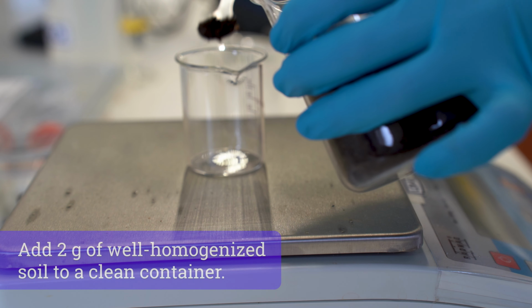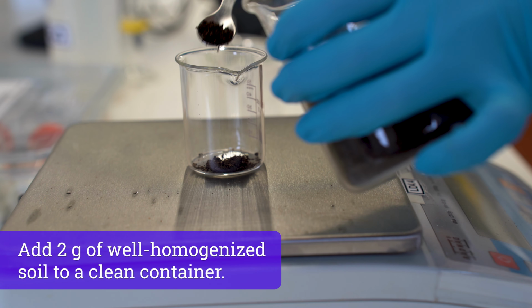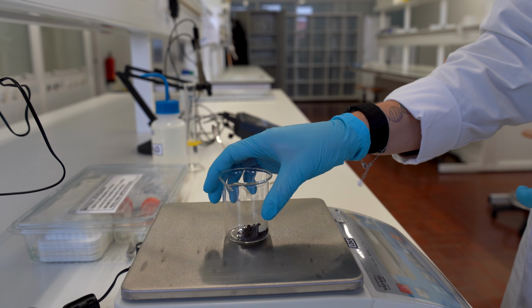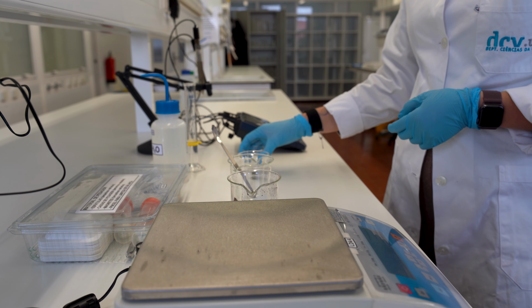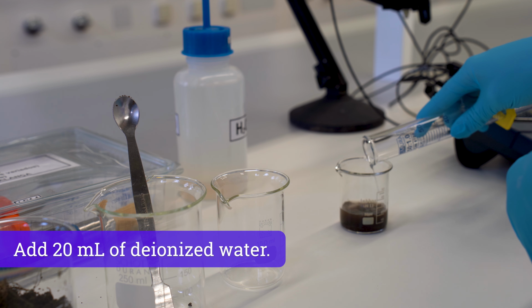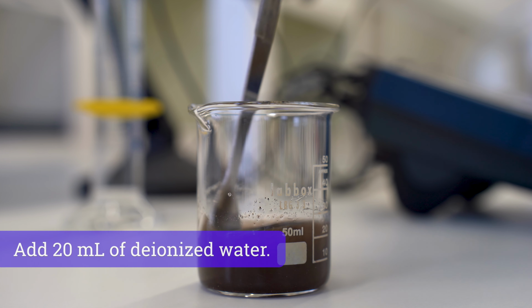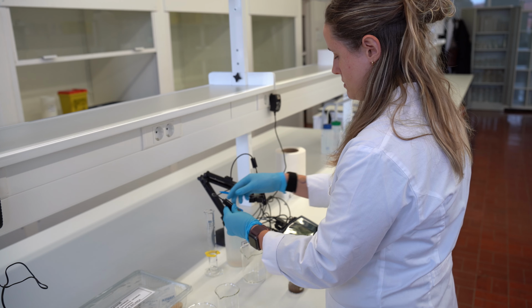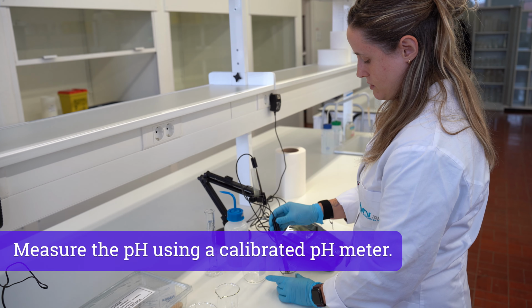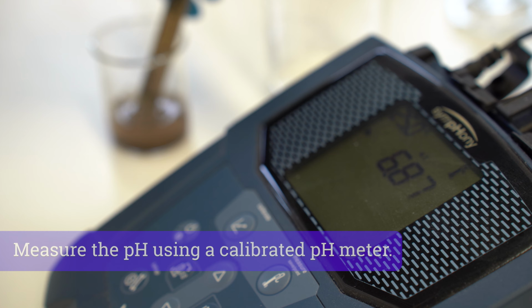Start by transferring 2 grams of well-homogenized soil from the previously prepared mixture into a clean container. Add 20 milliliters of deionized water and mix thoroughly to form a uniform suspension. Measure the pH using a calibrated pH meter and record the value once it stabilizes.